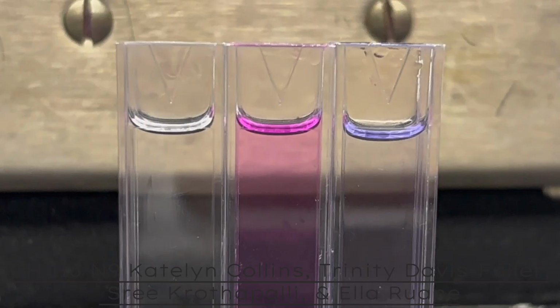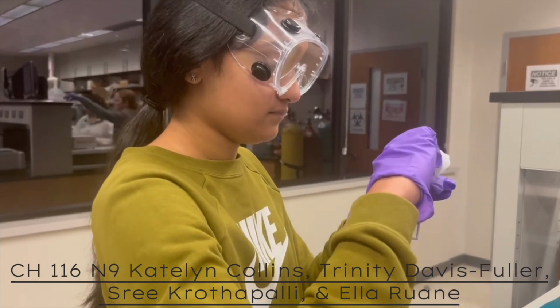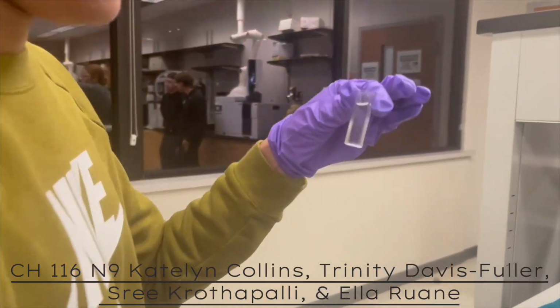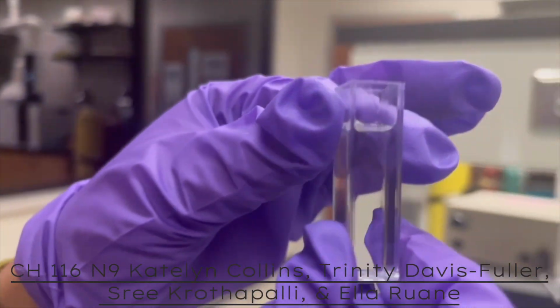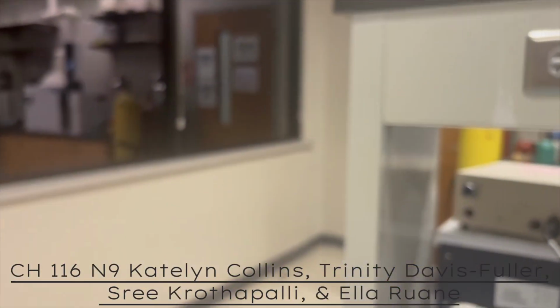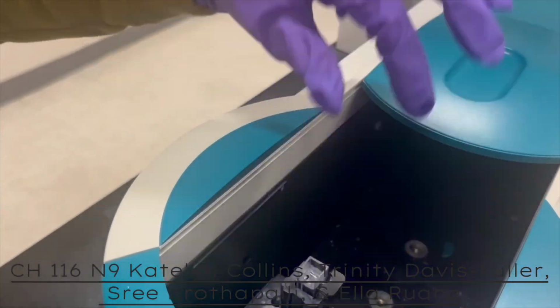bands. After confirming that the spectrophotometer is zeroed and set to scan the 200 to 800 nanometer range, gently and thoroughly wipe all sides of the cuvette, and gently place the cuvette in the machine with the clean sides facing the light beam. Close the lid of the machine and scan the absorbance of the sample. Record the absorbance of the sample in your notebook. Then carefully open the door, remove the cuvette from the machine, and close the lid back. Repeat this procedure with all samples.